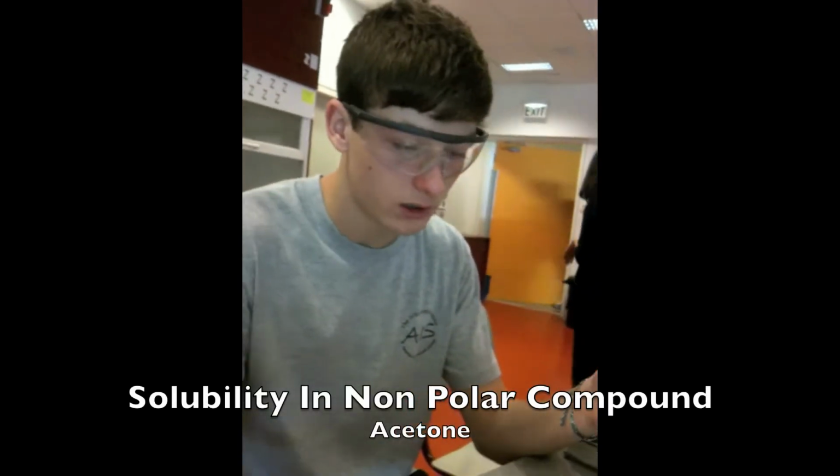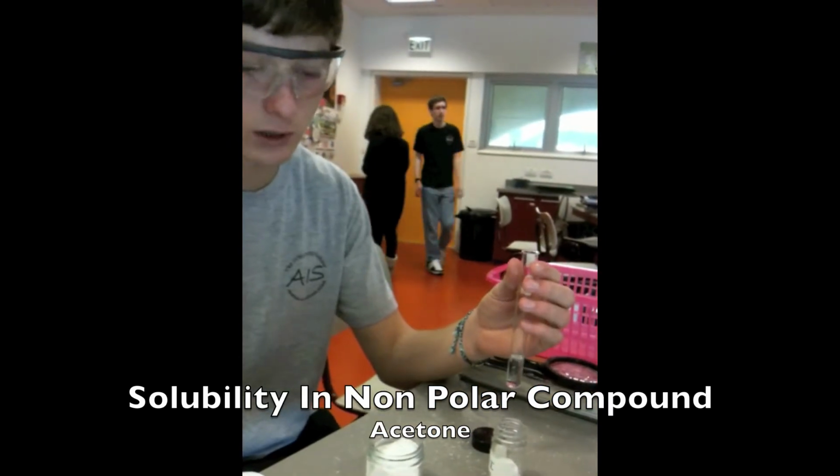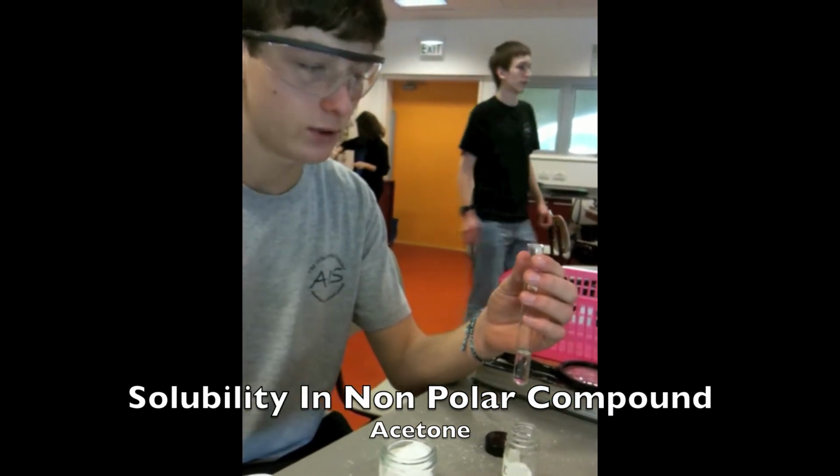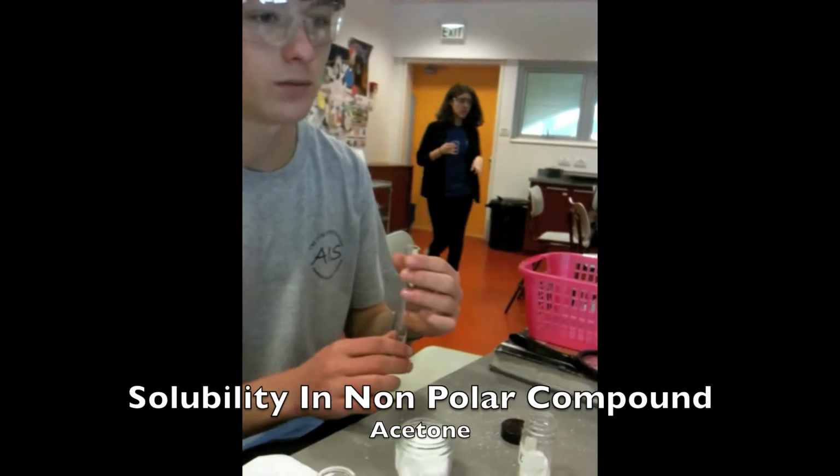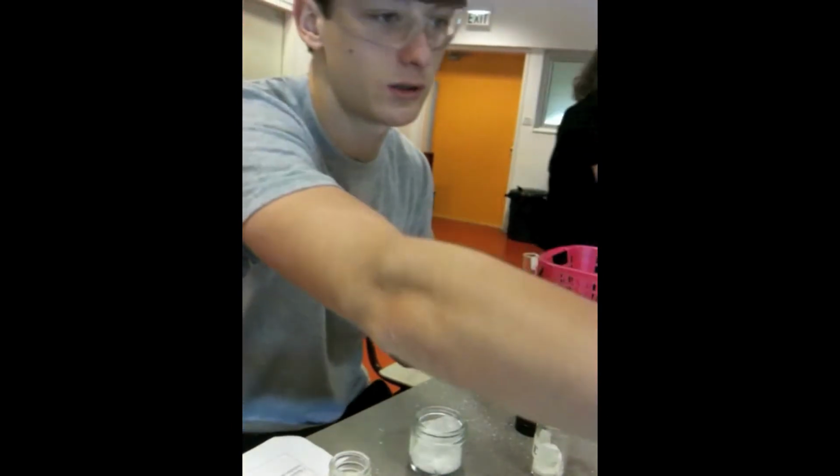Now we're doing part 5. It's basically the same thing, but instead of the tap water that we filled the tube with for part 4, we're using acetone, which is basically alcohol.